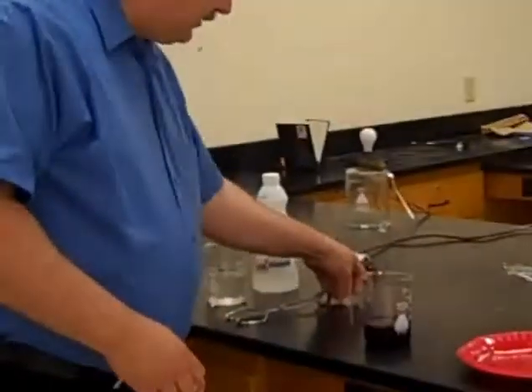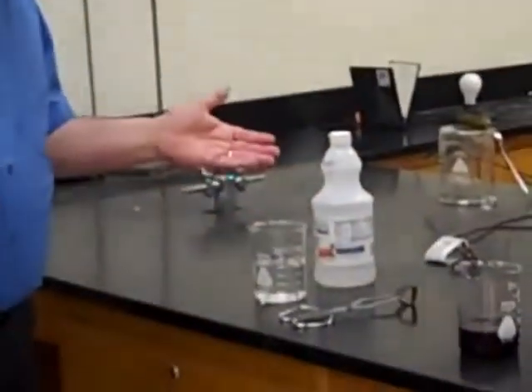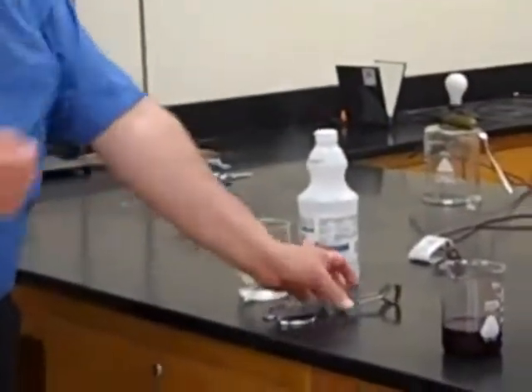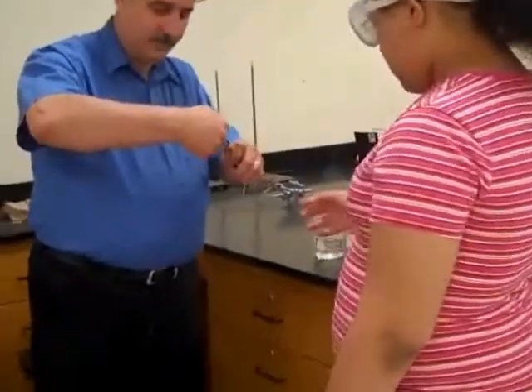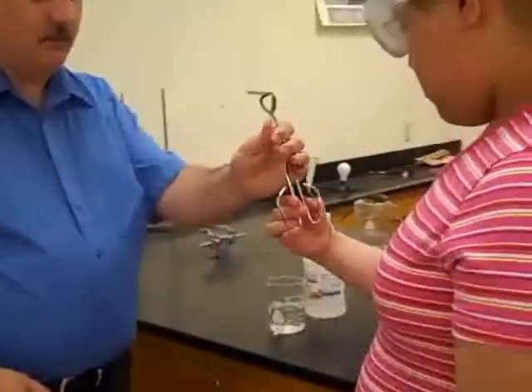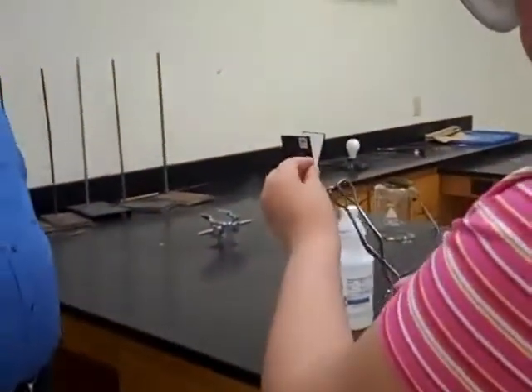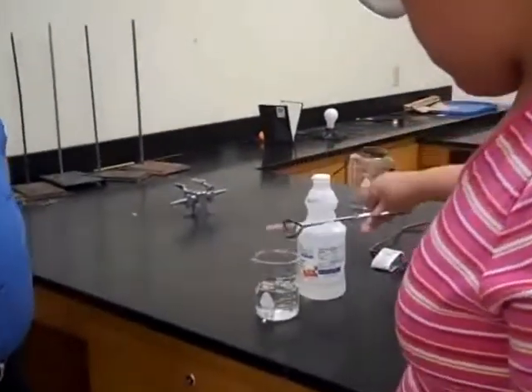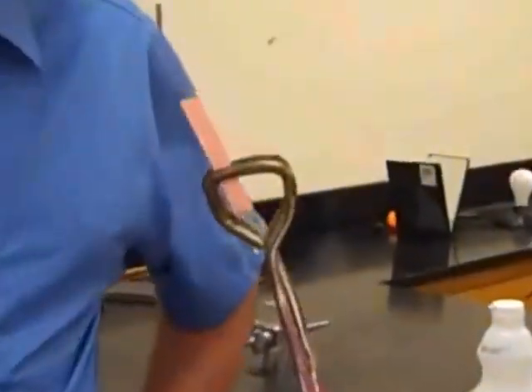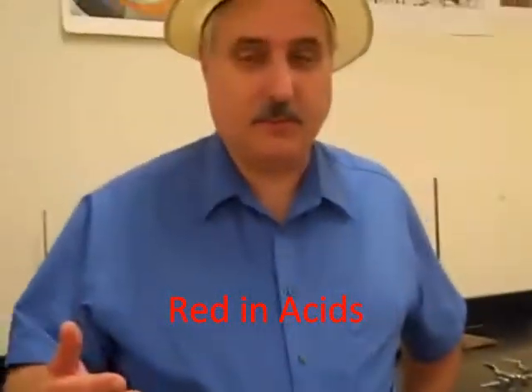Here we have some blue litmus paper, and here we have some vinegar, which contains acetic acid. So if you'll come over here, we're going to dip this blue litmus paper in the vinegar, and let's see what color it changes to. Okay? And it turned red. So that's another property of acids. They turn litmus paper red.